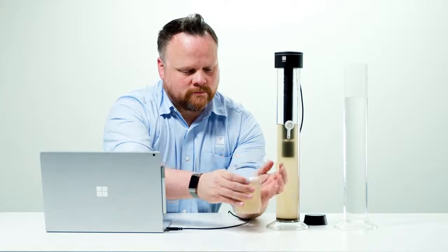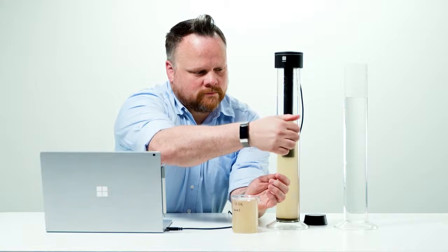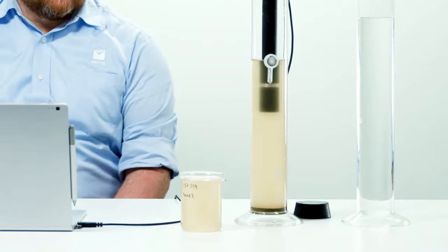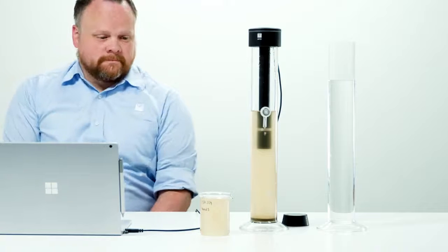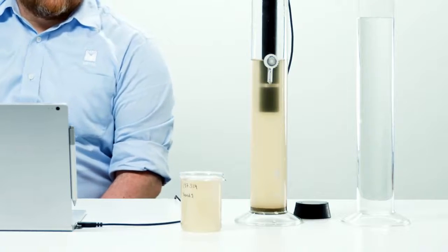PARIO Control automatically detects when the sample is collected because a steep pressure drop will occur. The measurement will continue to run for another 120 seconds to safely record the dropped pressure before it automatically stops the test. Let the PARIO continue running for 2 minutes after the small sample is taken to avoid interrupting the software. The software will automatically stop the measurement after 2 minutes.